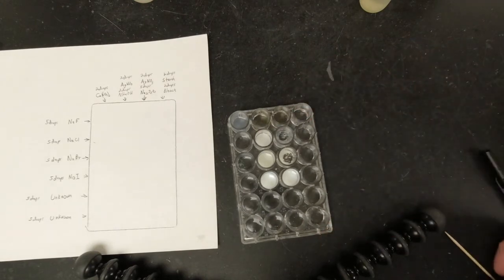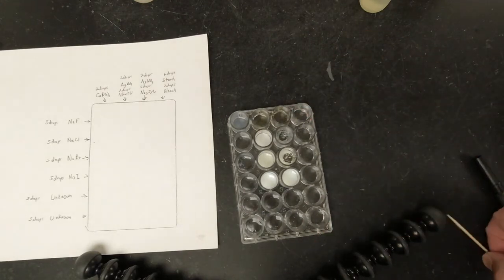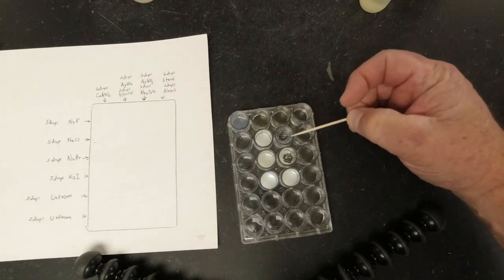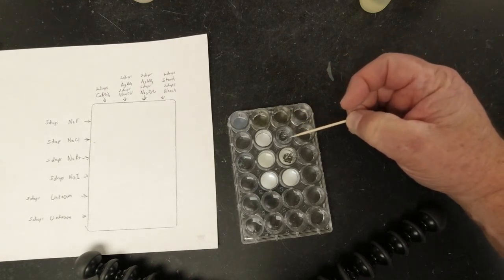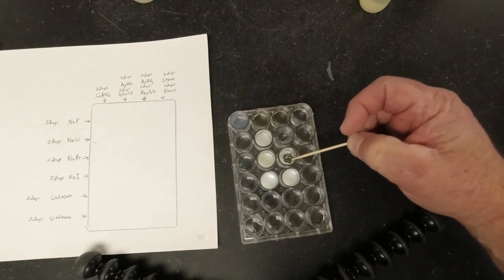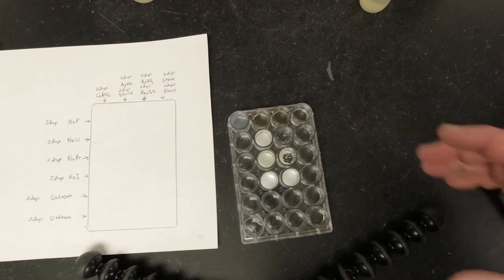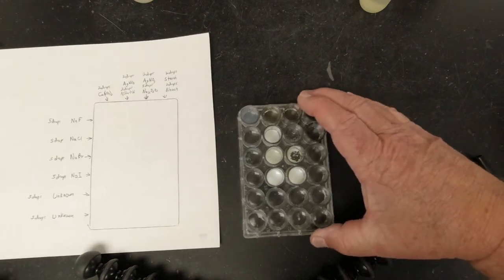Holy cow, there's a pretty significant change in this one. This one up on top had no reaction to it, but this one, wow, it faded a lot. This one faded quite a bit too. This one seemed to have not much of a change at all. Okay, pause that if you need to write that down.